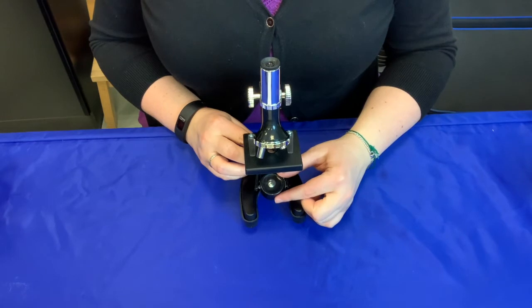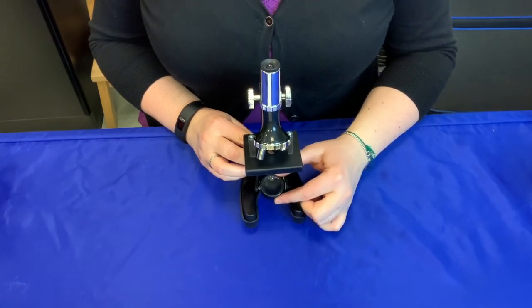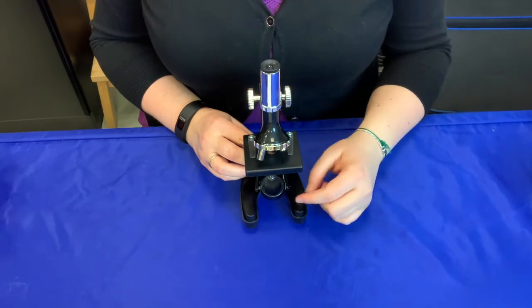We always want to be careful when using the microscope. So remember, don't point the mirror towards the sun and then look into the eyepiece as it could damage your eye.